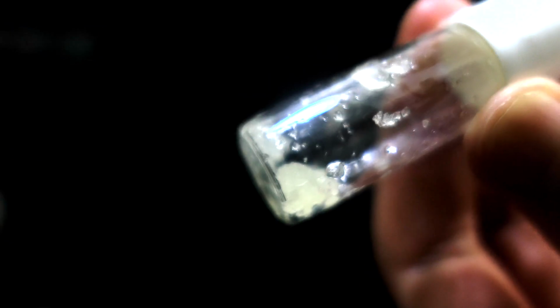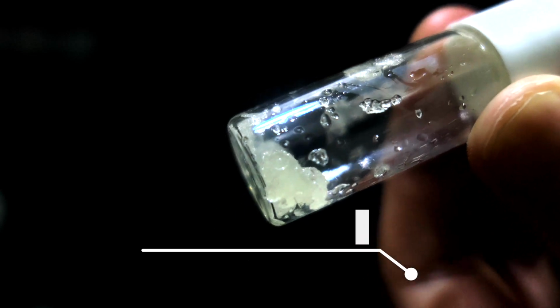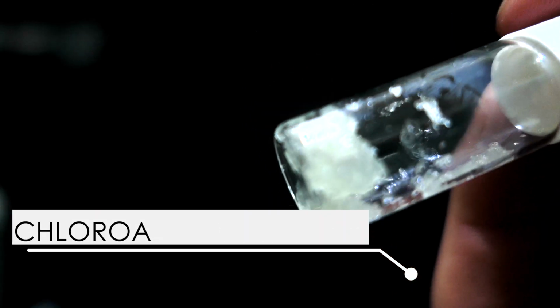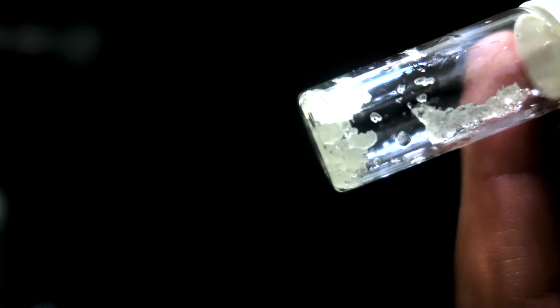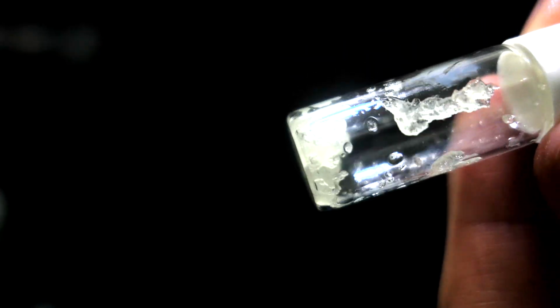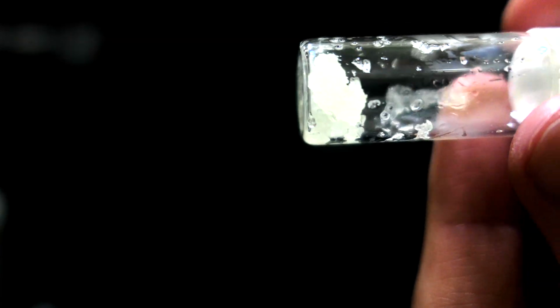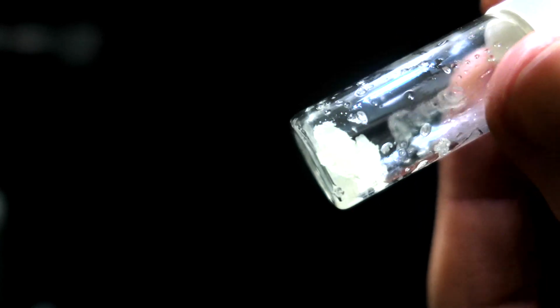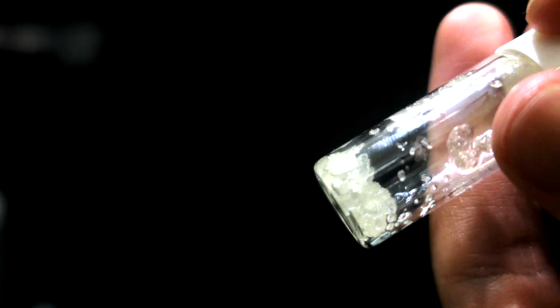In today's video, we're going to synthesize an analog of superacid, chloroantimonic acid. It is the analog of the famous superacid, fluoroantimonic acid, which is well known for its ability to dissolve glass and turn any organic material, such as human flesh, into carbon in an instant. However, chloroantimonic acid is not a superacid. I'm just making it for fun.